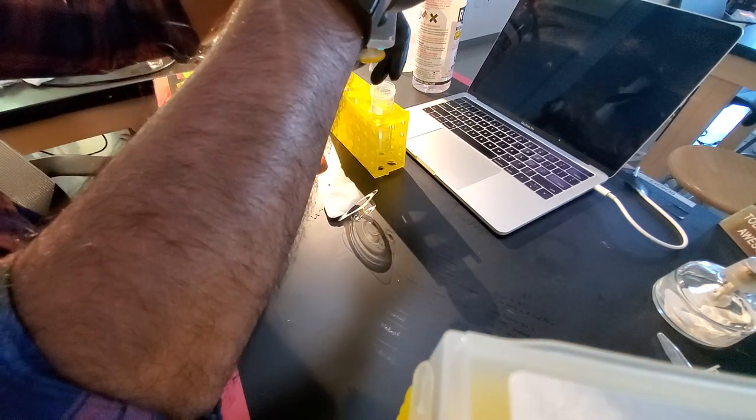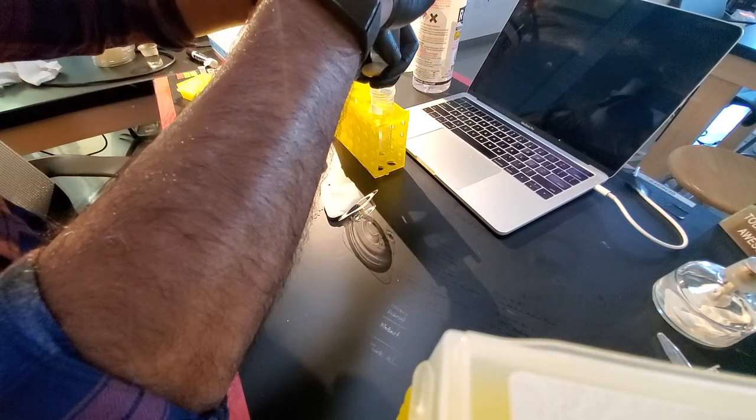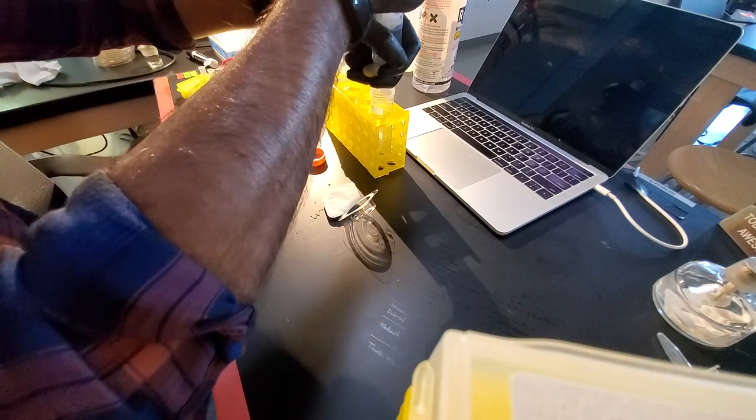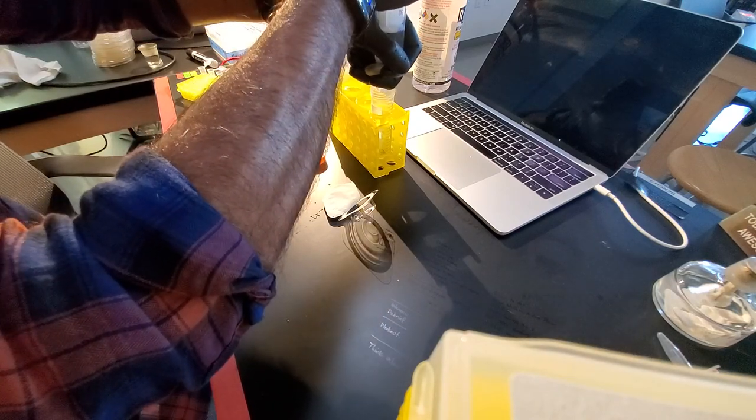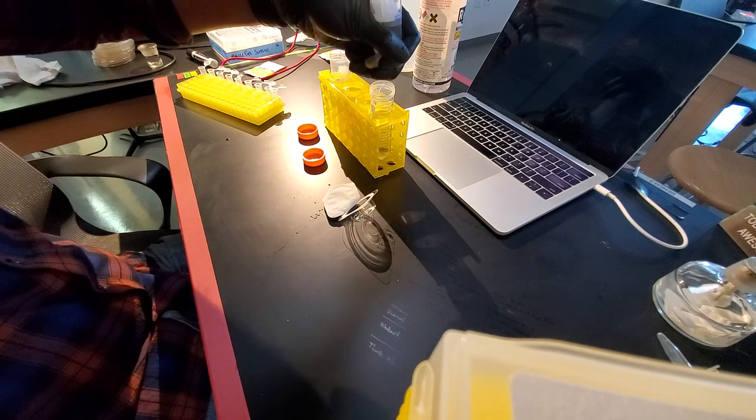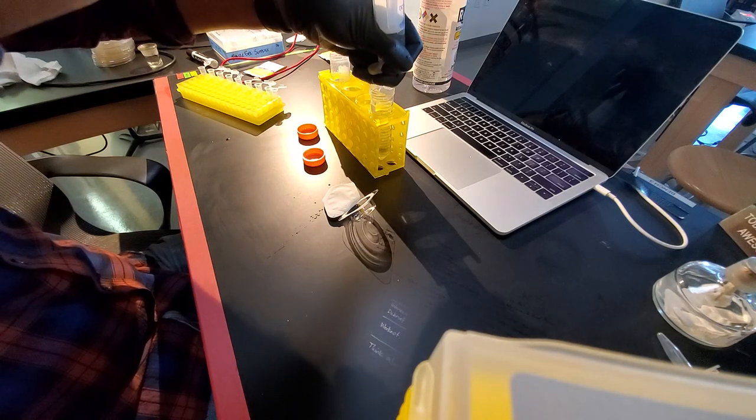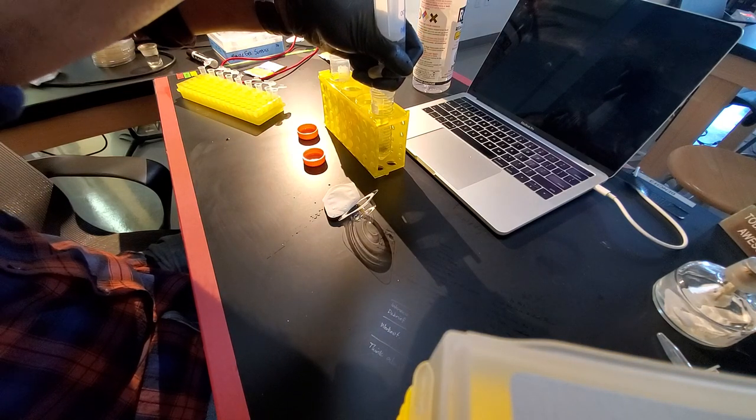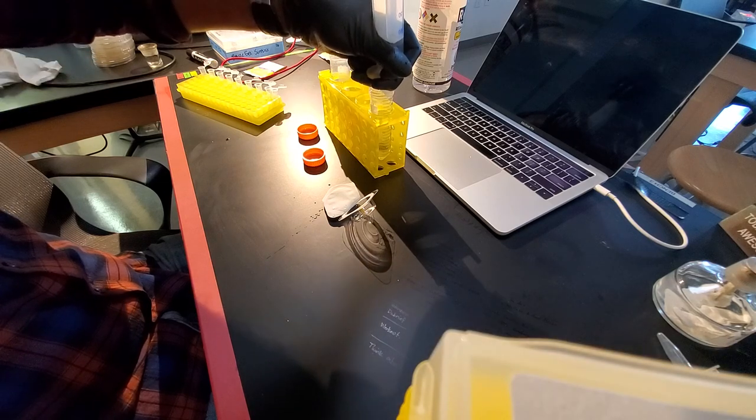And then I'm going to hold this filter like this and push. And different filters require different amounts of strength. So you can actually, these can actually be pretty tough. This method actually works pretty well for me. I usually have to take a few breaks while I'm doing it.